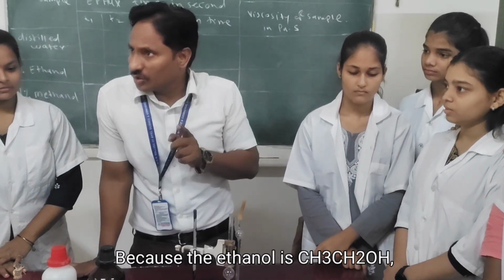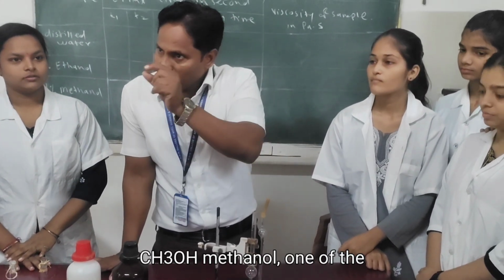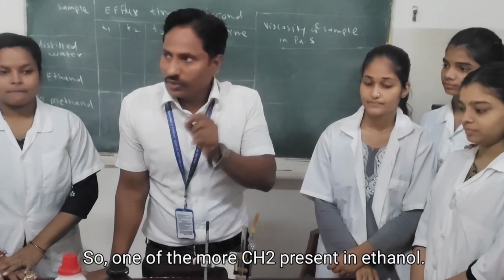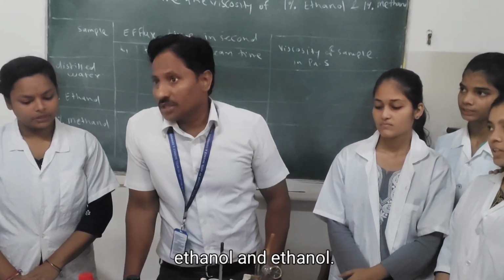Because ethanol is CH3CH2OH and methanol is CH3OH. So one more hydrocarbon group is there. Hydrocarbon means carbon and hydrogen. So one more CH2 is present in ethanol. So let's compare today the viscosity of ethanol and methanol.